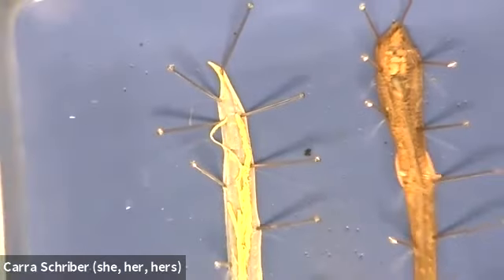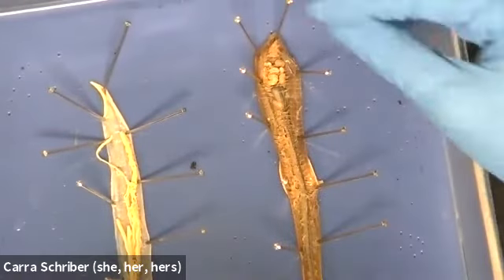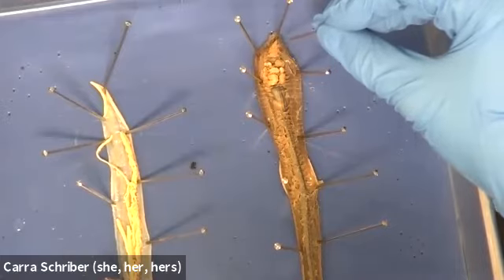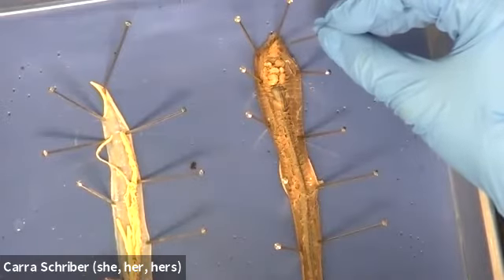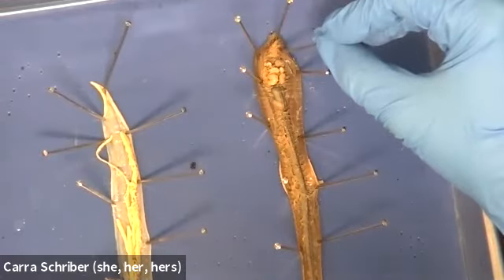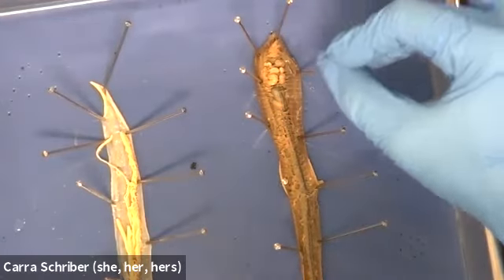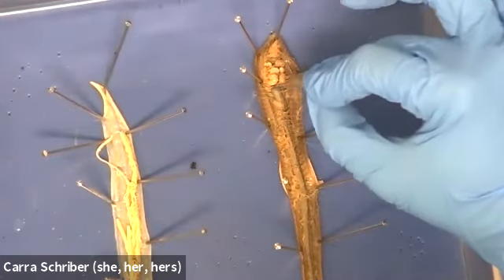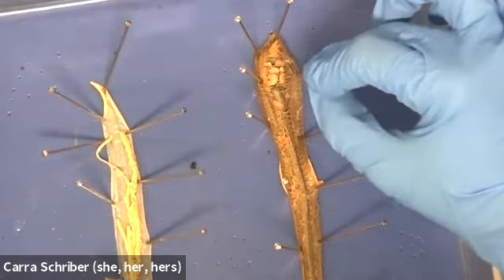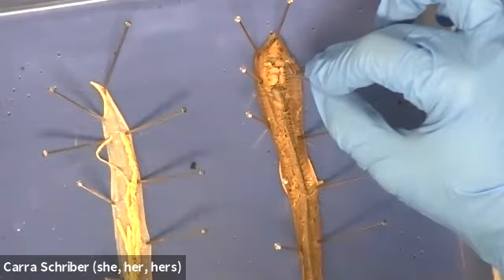All right, so how does that differ then from our earthworm? Let's start at the very tip of the earthworm. We have the mouth, and then we have this implied esophagus or pharynx, like we were talking about with our roundworm. It's not visually very distinct, but I know that it's there because it comes after the mouth. And then you'll see these white, chunky globs. This is not part of the digestive system, but I'm going to point it out to you because I think it helps us to orient ourselves as to what we're looking at.